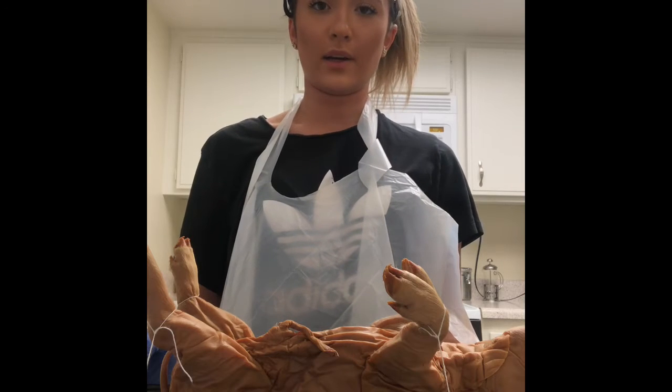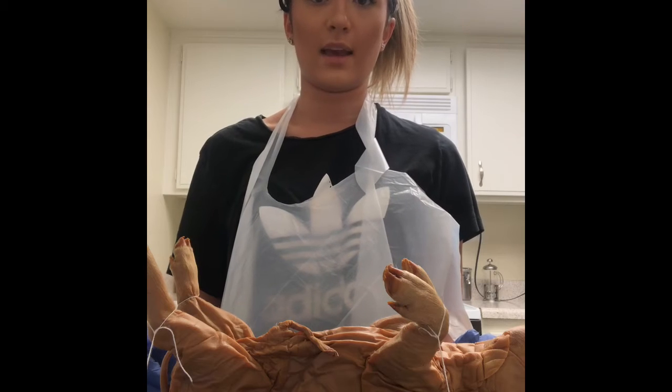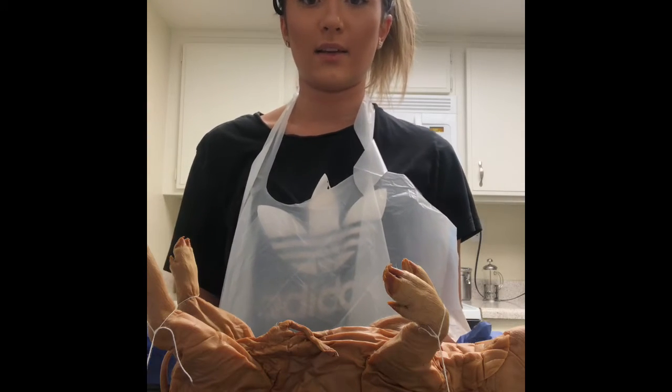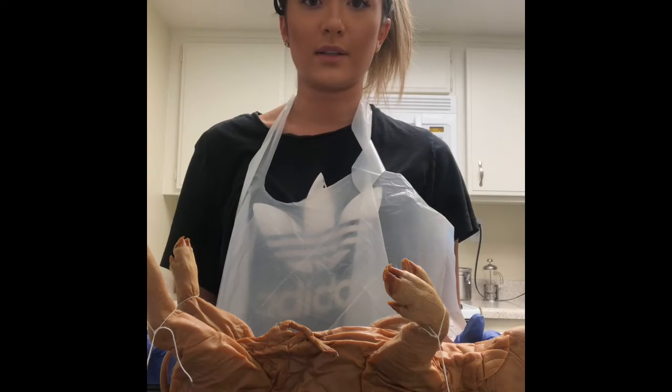This is week 3 video lab exercise of the cardiovascular system and blood vessels. In this week's video, I will be dissecting a fetal pig as well as labeling and identifying different parts of the pig.